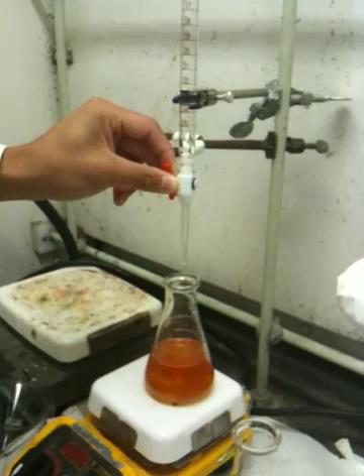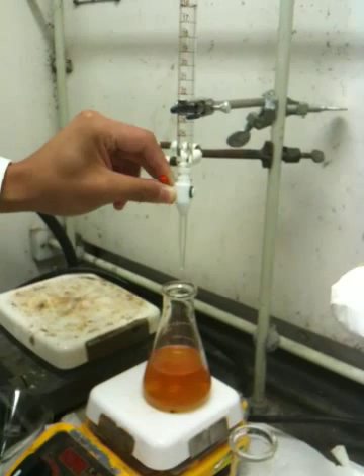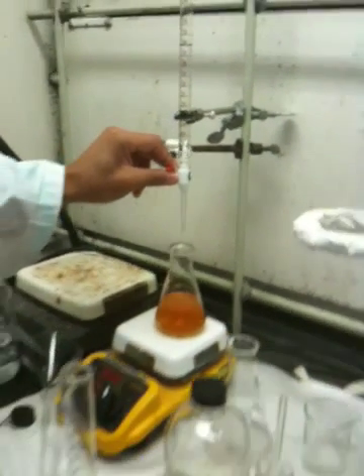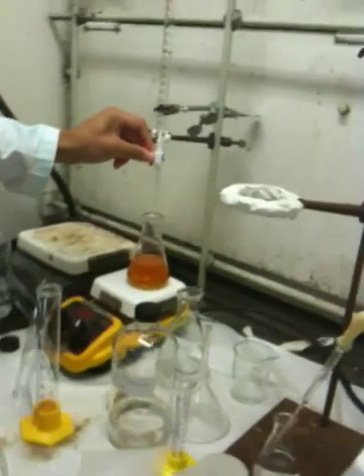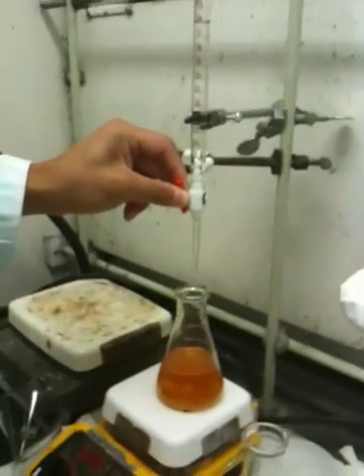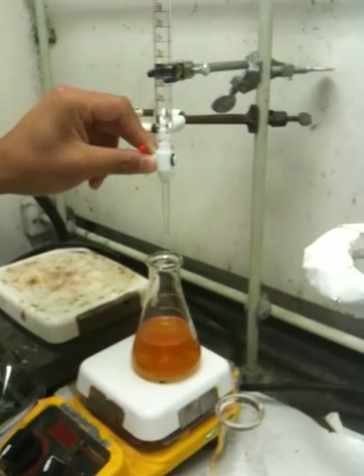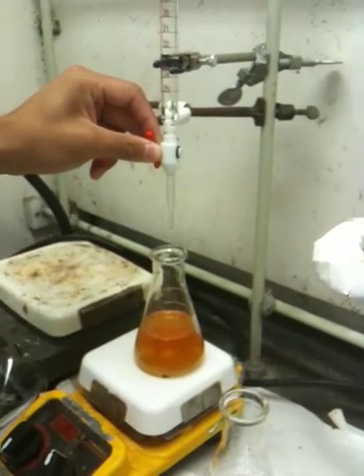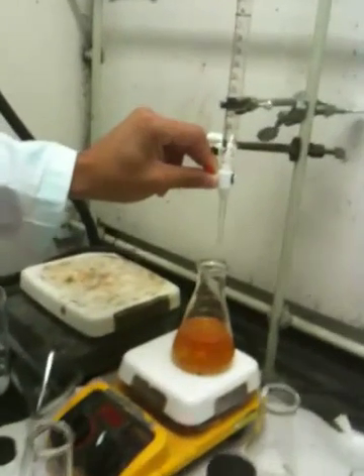10 mils of — what is that stuff called? Some kind of acid. H2SO4 — sulfuric acid, duh. And it has 1 gram of potassium iodide, and another 0.1 gram of sodium bicarb.